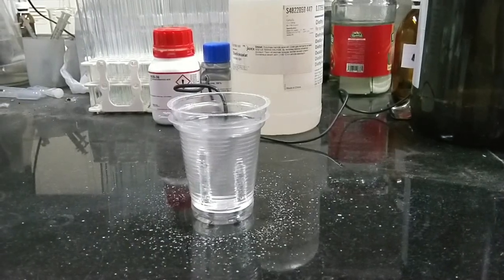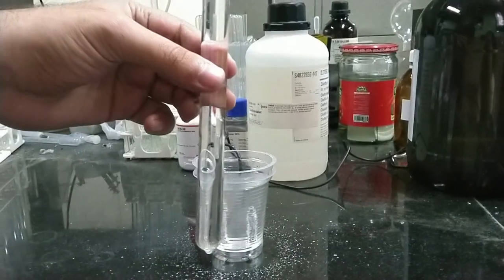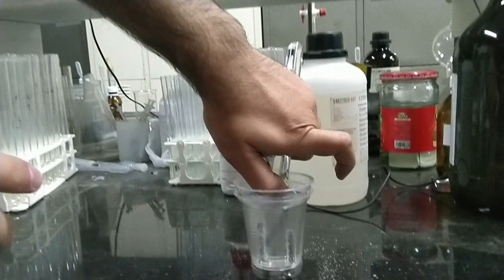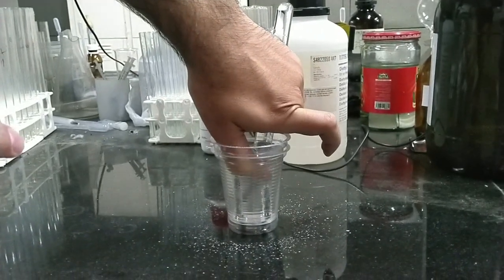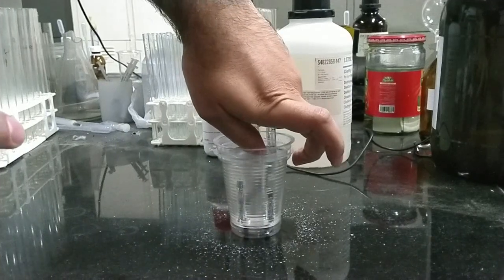Now to save the gases I use a test tube full of water. Then I upside down the test tube into the solution. Now I put it on the electrode.